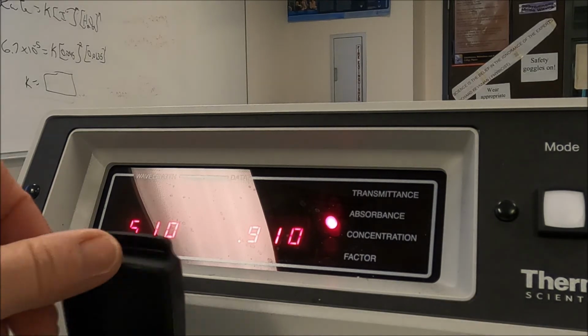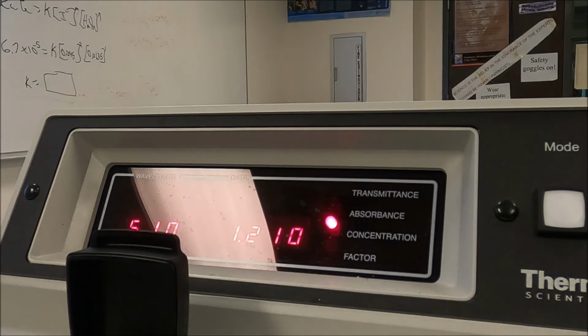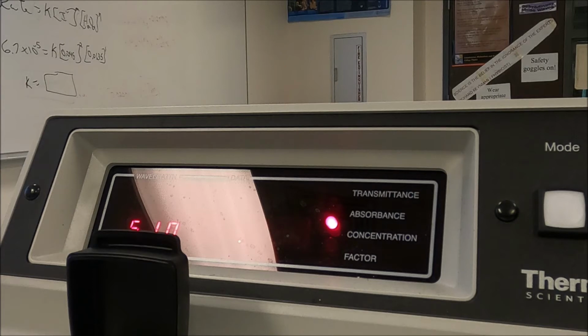I think we may only have unknowns 1 and 2. Okay, we're going to do an unknown number 3.